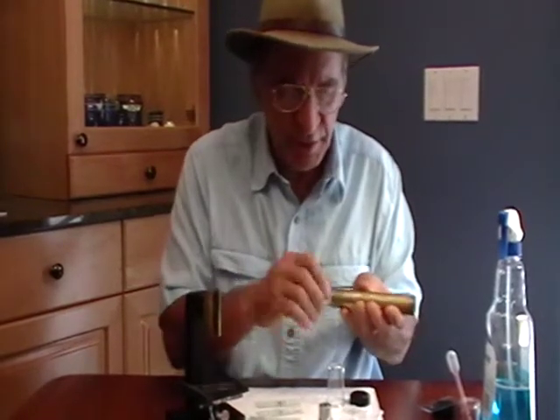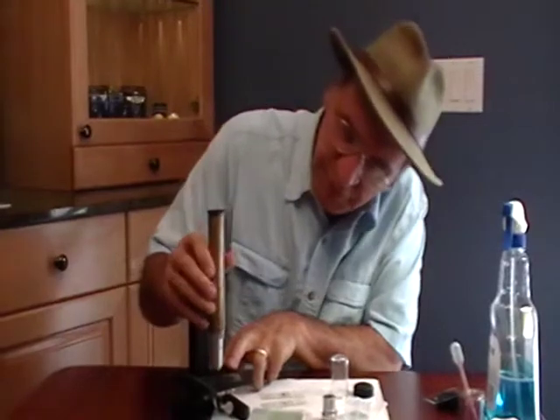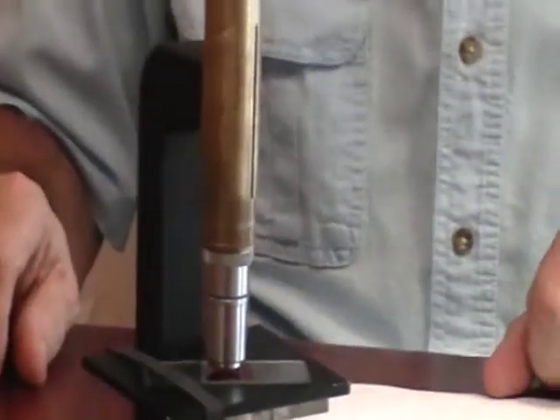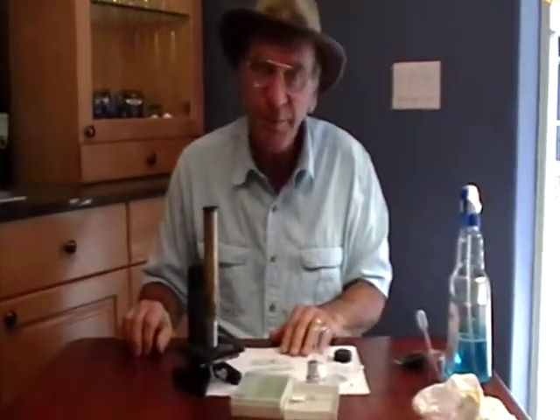Try not to touch the end — stay away from it. Put it on the ramp, start at the top, go down until you can see it's just above the slide, and then crank it up a little bit. You should be fine. And I think that's pretty much it. Let us know if we can help you. Thanks again. Bye.